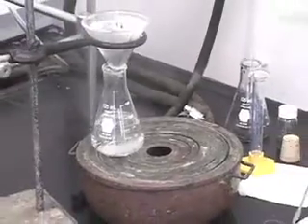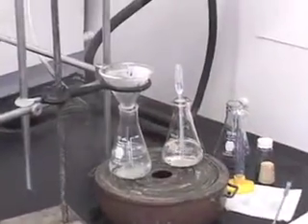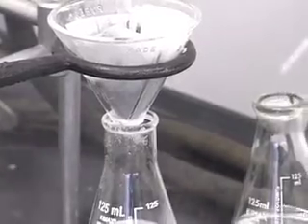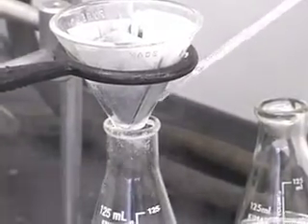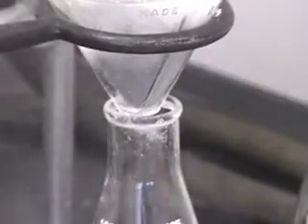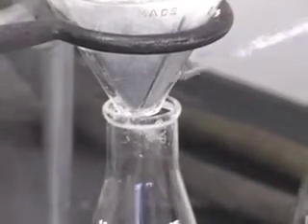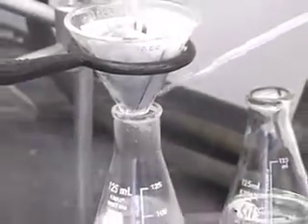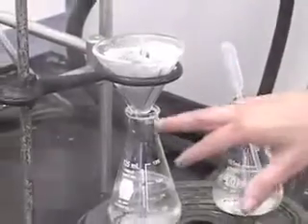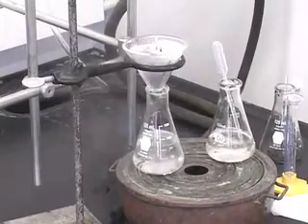Okay, if in the meantime you notice that there are some crystals that are forming at the tip of the stemless funnel, what you can do is just take a little bit of hot solvent and squirt. That will redissolve the crystals that are formed, and so this way we won't lose any of our material. When you notice that there isn't any more filtrate dripping from the stemless funnel, you are ready to start concentrating this solution.